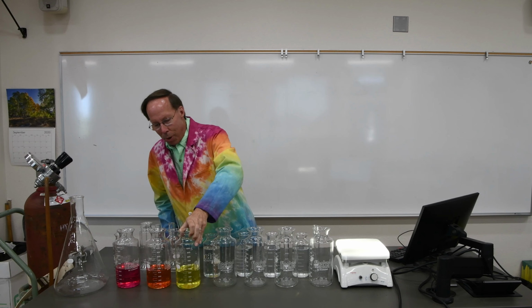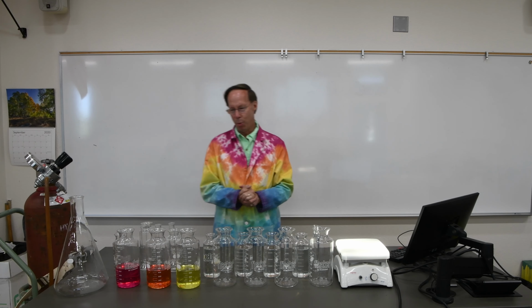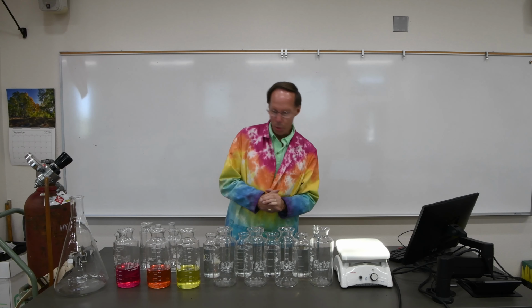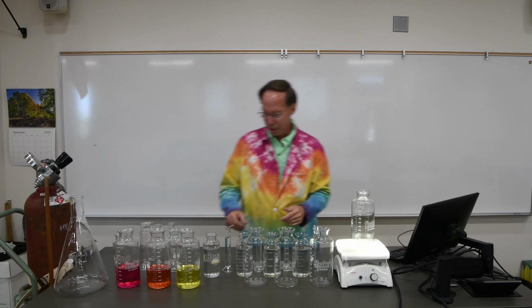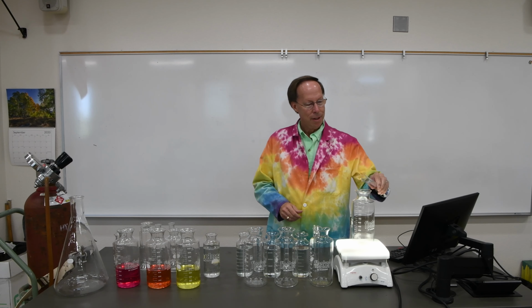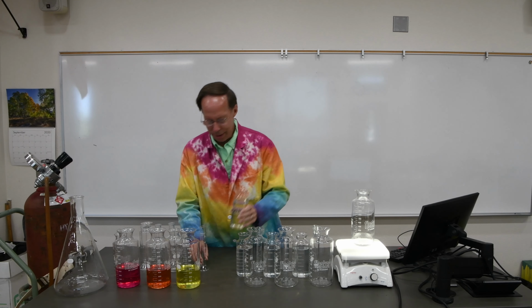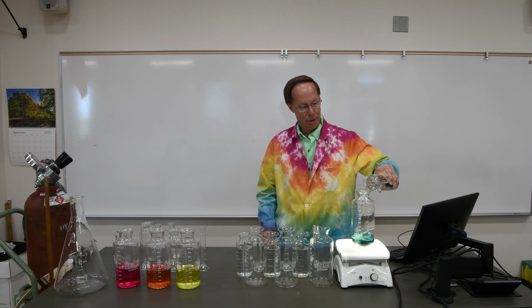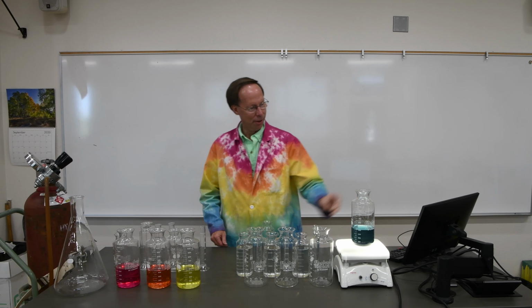At this point, you're probably realizing this looks a lot like the colors of the rainbow. Roy G. Biv: red, orange, yellow, green, blue, indigo, and violet. So let's go ahead and see if our prediction is correct. If we are predicting correctly, the next color ought to be green. Well, lo and behold, it's a lovely green color.